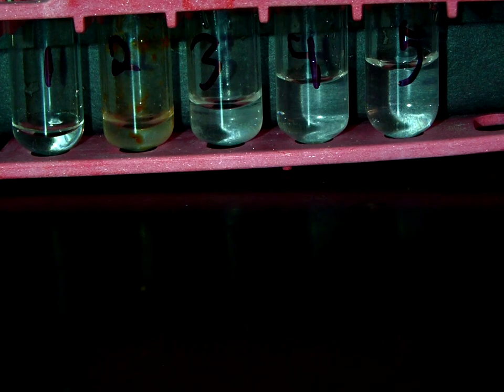So now we're going to add some sodium carbonate to each one to get our total number of drops up to 24. As I do this, I want you to write down any observations that you notice in the test tube of any signs of reaction to begin with. If needed, pause the video after I add some of the sodium carbonate. So test tube 1 is going to get 20 drops.